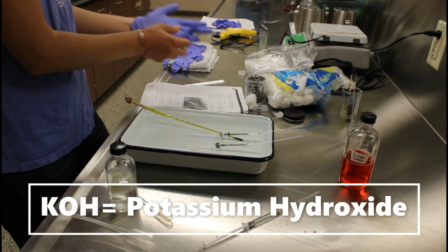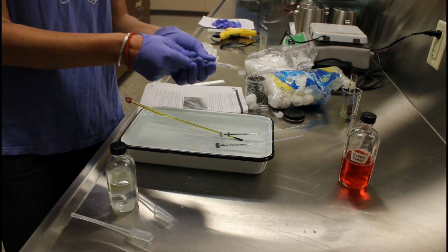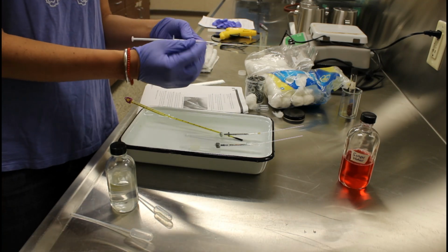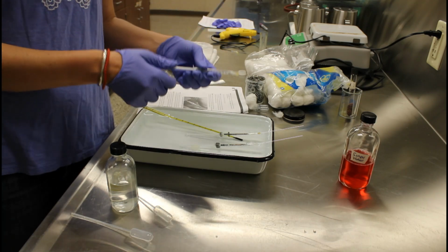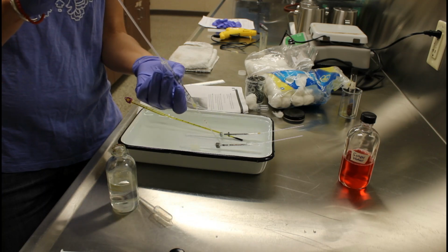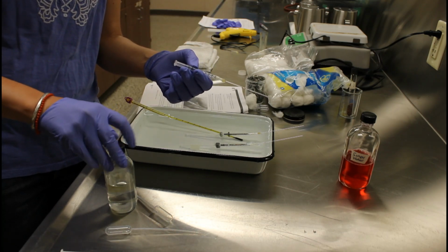The deal with the KOH is that within cellular respiration, there's a couple of things happening with gases. While oxygen is being consumed, the gas carbon dioxide is also being created. And if we have one molecule being generated that's a gas and one being taken up that's a gas and converted to a liquid form in this case, we may not see the volume of the gas inside this chamber change at all. So we want to just kind of strip the carbon dioxide that's being generated as a result of cellular respiration. And the KOH will do that for us. So I'm just going to put a drop of KOH down here, and that's going to take care of the carbon dioxide that's generated by the reactions of cellular respiration.